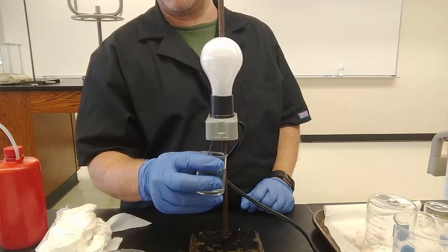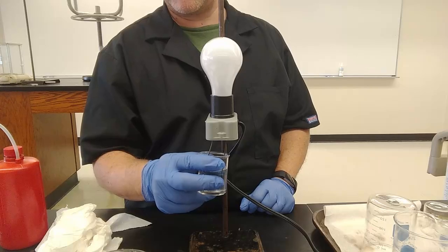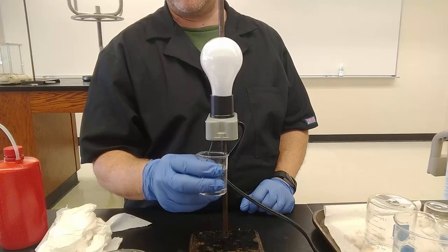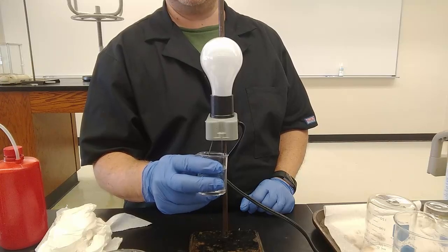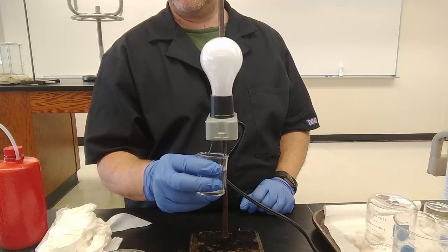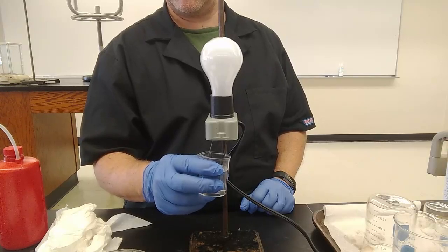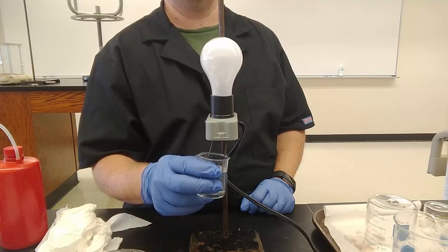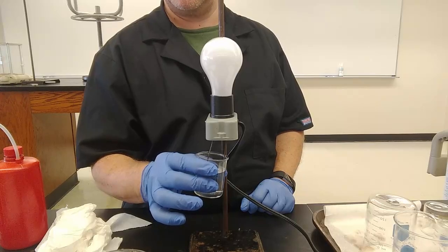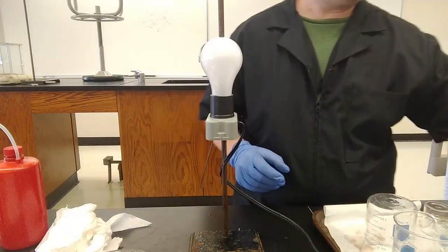Because normally for an ionic compound you have a metal cation, or ammonium as your cation, and then some sort of anion. Maybe it's a halogen like Cl minus, maybe it's a polyatomic ion like HCO3 minus bicarbonate, or CO3 2 minus carbonate. We don't seem to have that in sucrose. It's just C12H22O11. There's no metal. So maybe this is not ionic. I leave it to you to decide. But our sugar water definitely has no light.